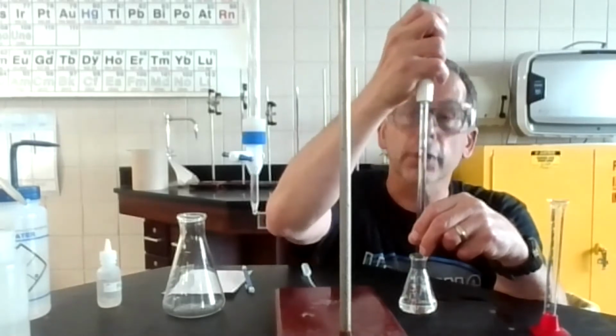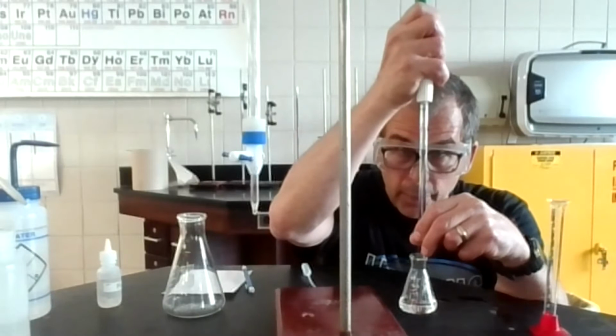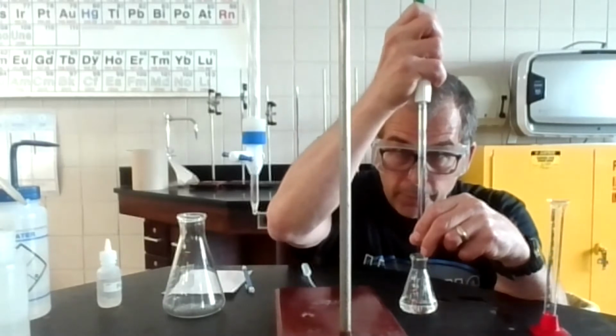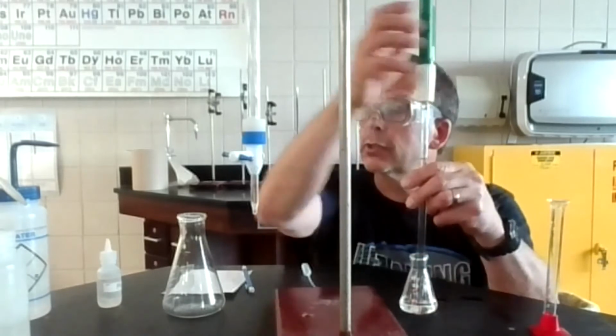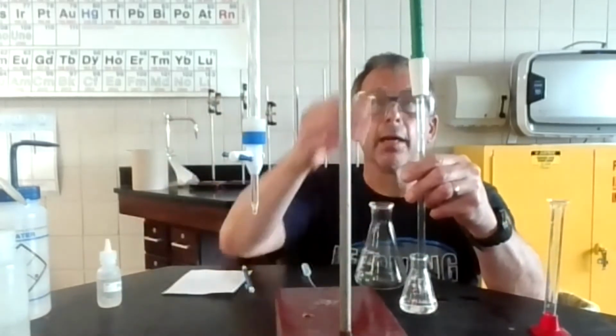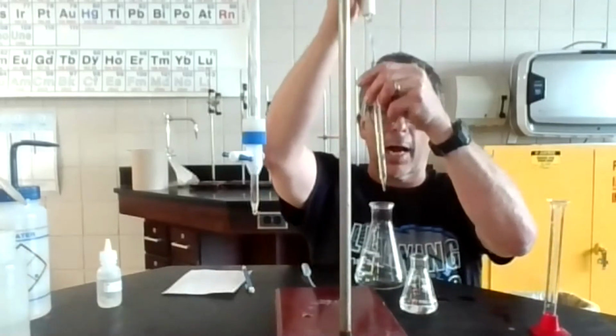Okay, and it looks like it's holding. I got a pretty good one right here. I'm going to drop a little bit out. Quick. Okay, that looks good. And then here's my flask. I'm going to drop it in here.